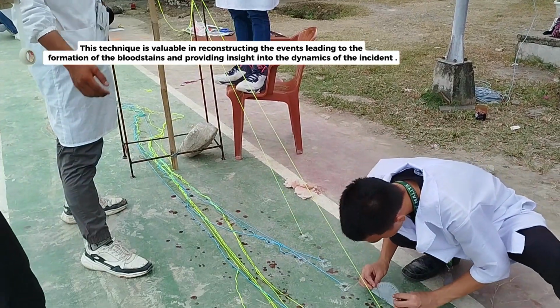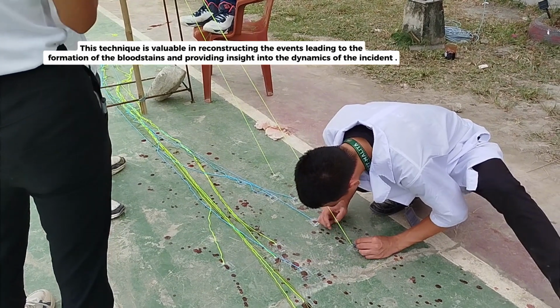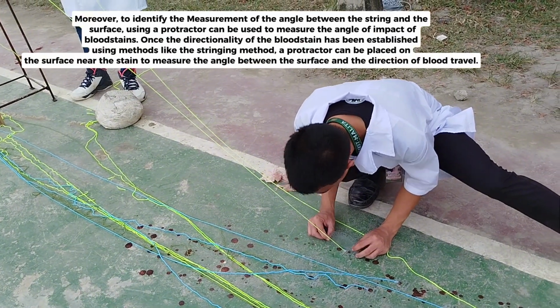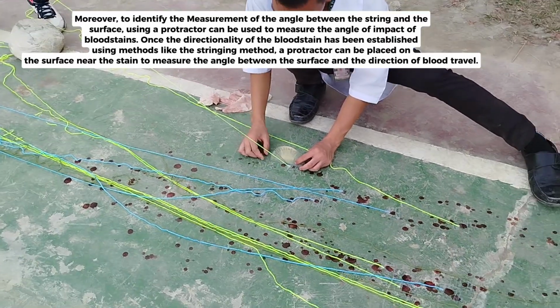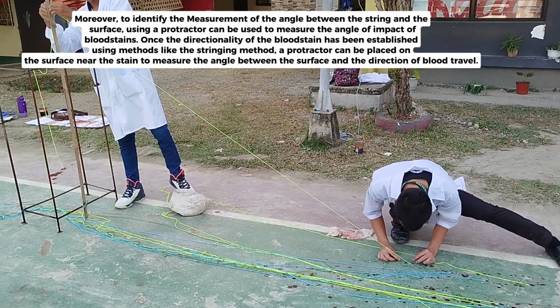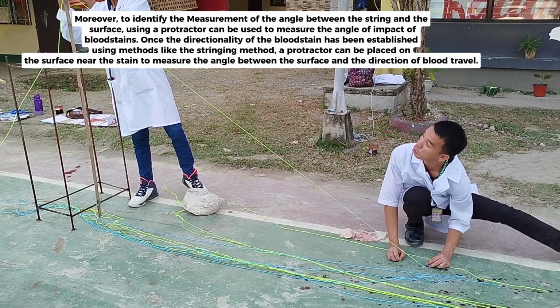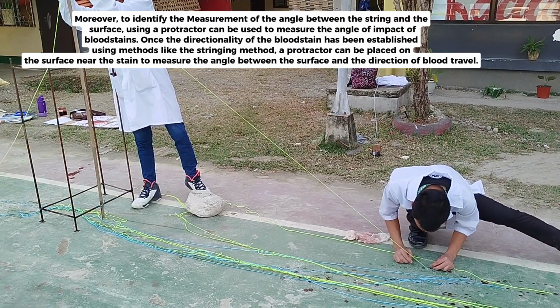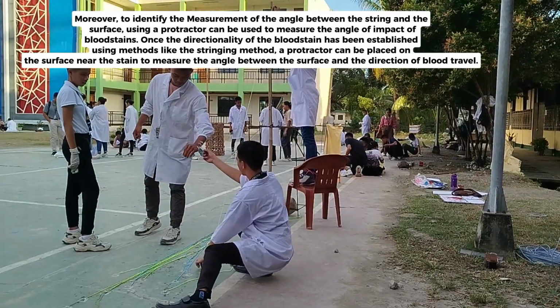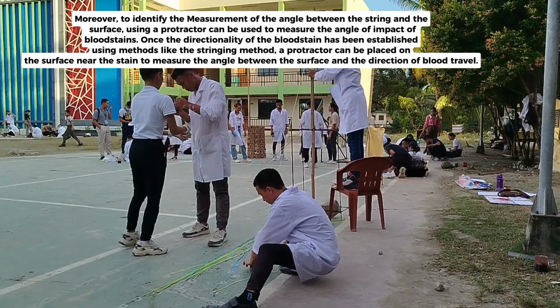This technique is valuable in reconstructing the events leading to the formation of the bloodstains and providing insight into the dynamics of the incident. Moreover, to identify the measurement of the angle between the string and the surface, a protractor can be used to measure the angle of impact of bloodstains. Once the directionality of the bloodstain has been established using methods like the stringing method, a protractor can be placed on the surface near the stain to measure the angle between the surface and the direction of blood travel.